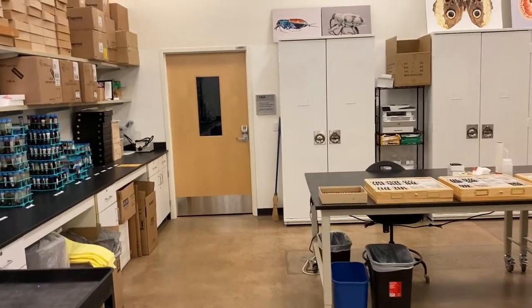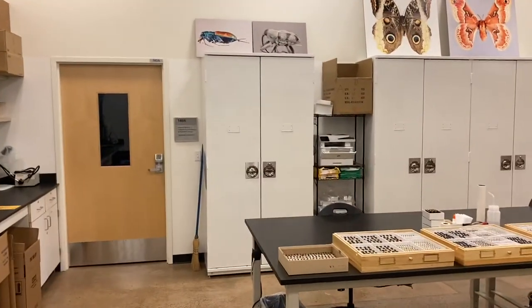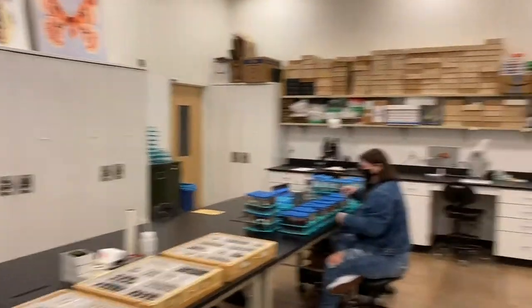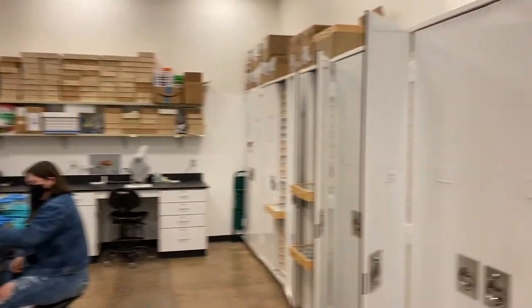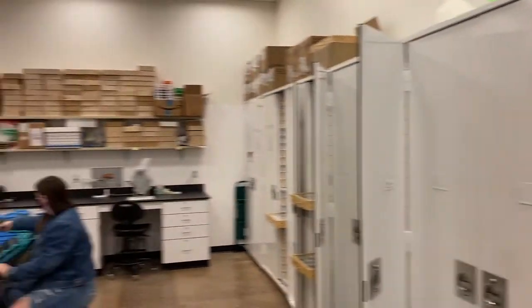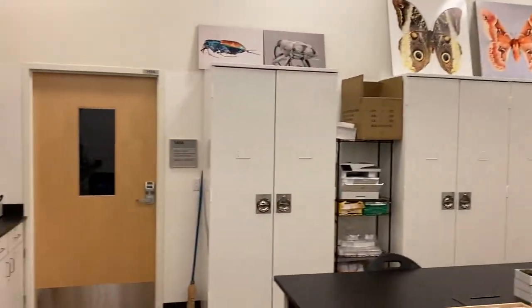Welcome to the invertebrate collections of the NEON Biorepository. This is our primary workroom and pinned insect collection at the moment.